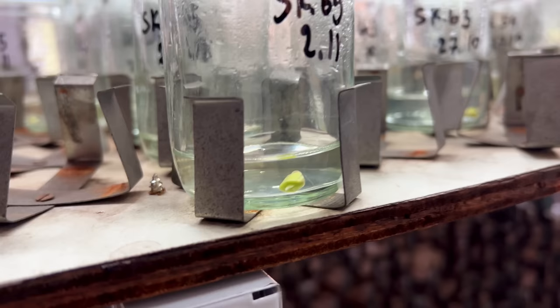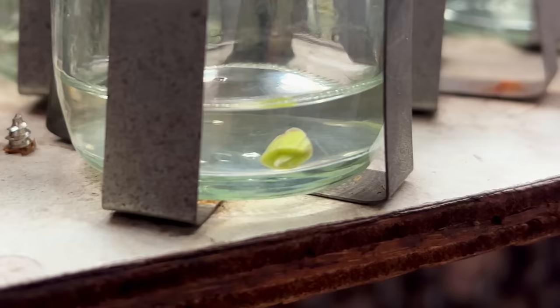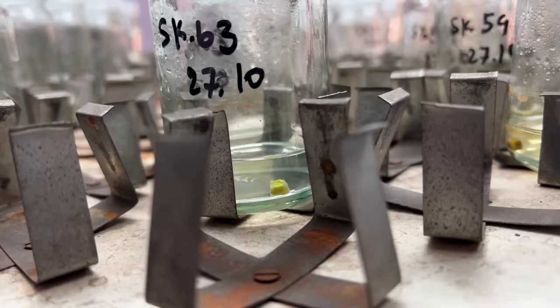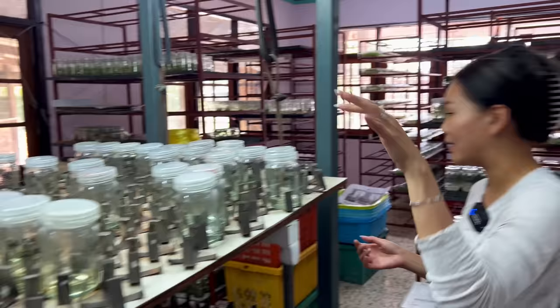So this thing will turn into life. This looks like a cut stem. It is. And it's really very hard to know where to cut, how to cut, and how to find the right recipe that it likes.